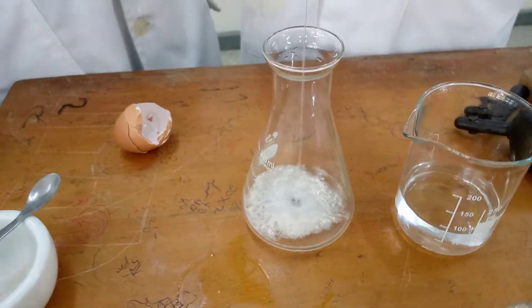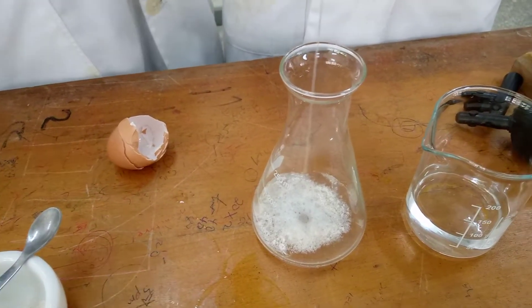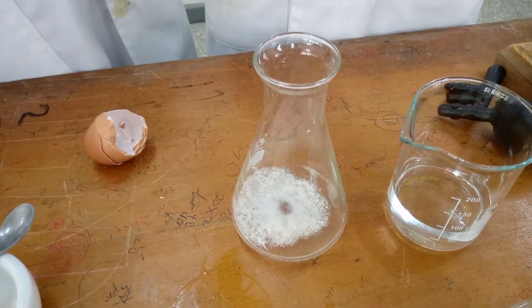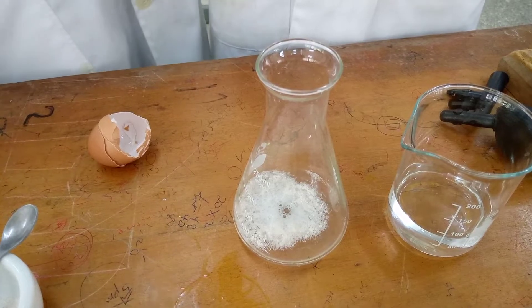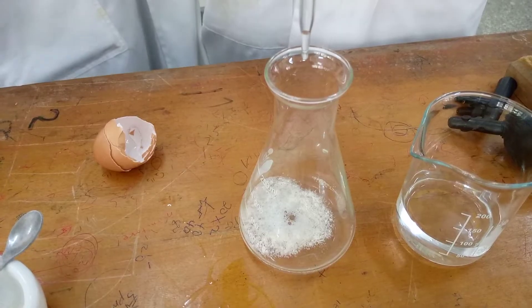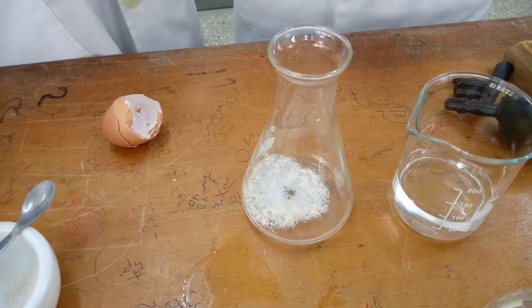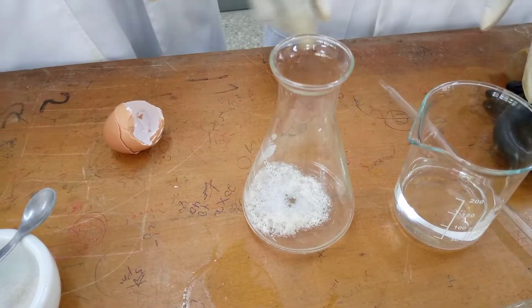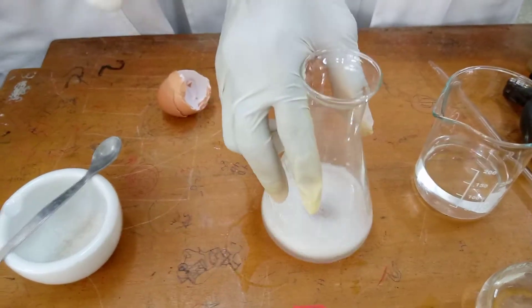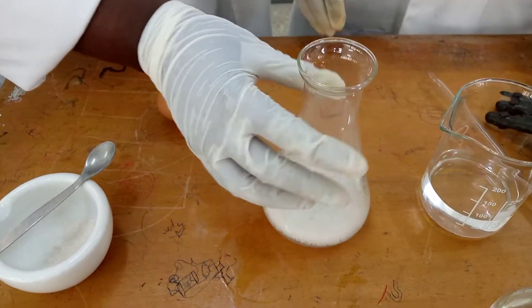The principle behind back titration is that we react an analyte with excess reagent. In this case, our analyte is the eggshell and the reagent is the HCl. We have to react these two, but the HCl is supposed to be in excess — because we don't know the exact amount of calcium carbonate content in the shell. As you can see, CO2 is being produced, which is why we can see the foaming on the surface.